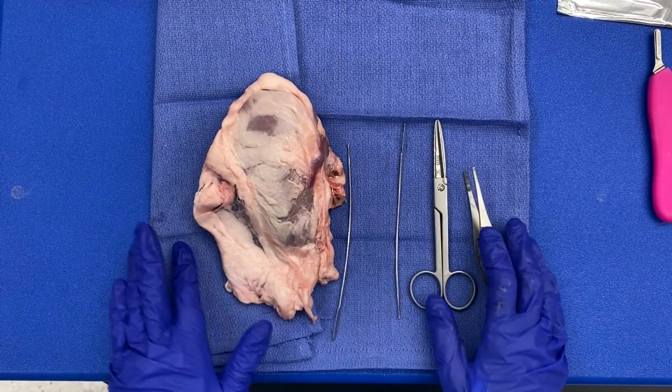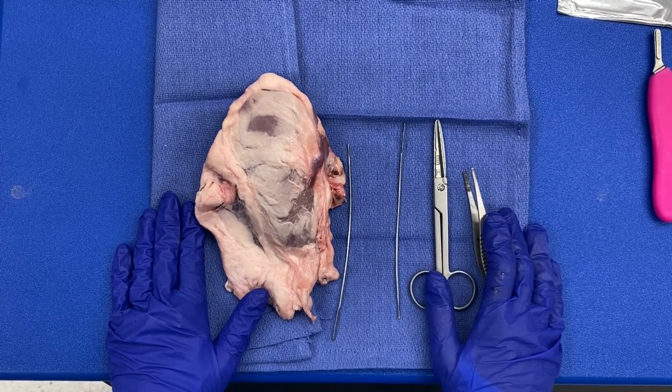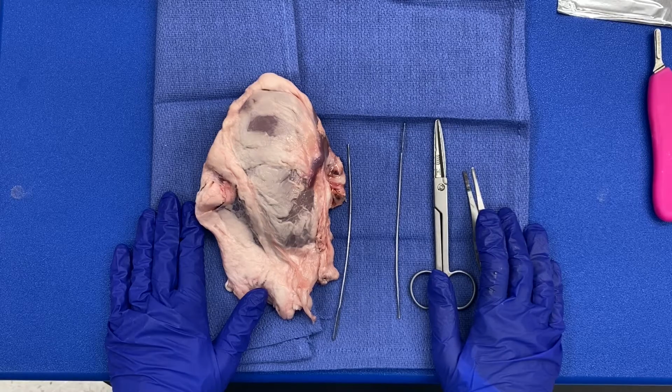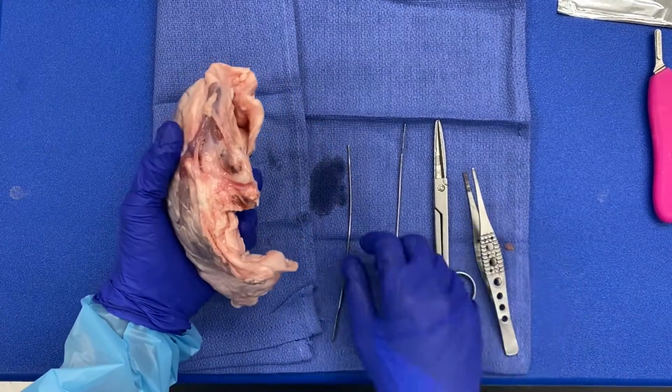The next thing we'll talk about is the orientation of the pig kidney and the human kidney. The human kidney orientation is such that the renal vein is the most anterior structure, the renal artery is posterior and slightly superior, and the ureter courses caudally and is the most posterior structure. So we'll go ahead and look at those hilar structures on this pig kidney.